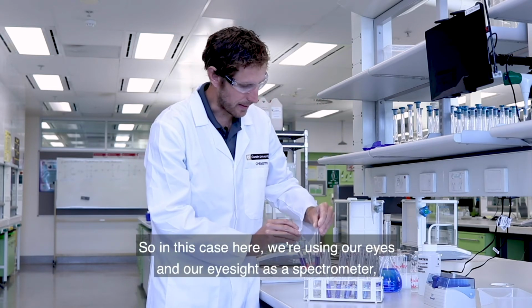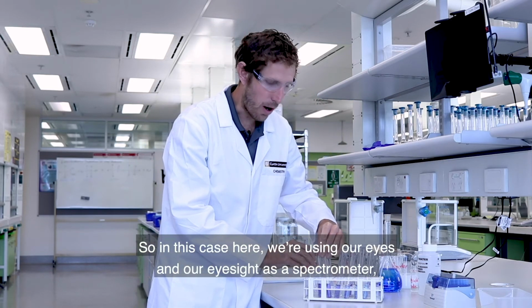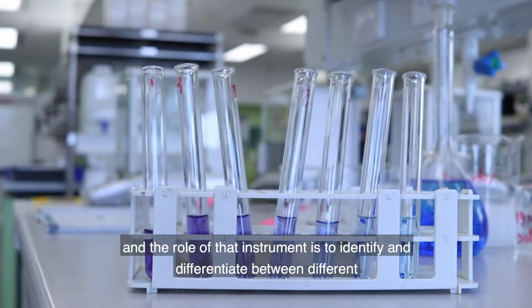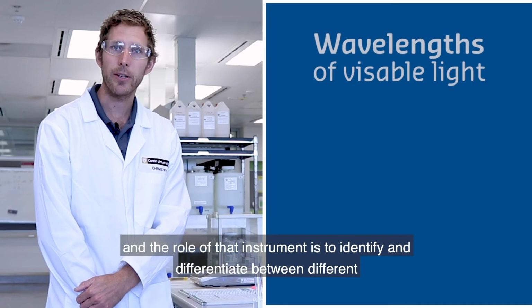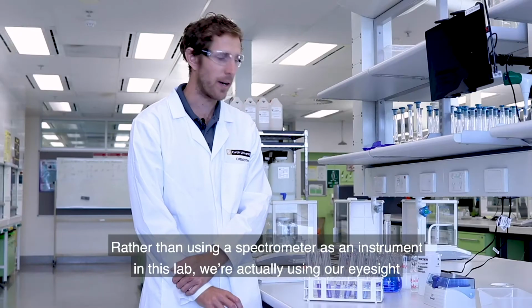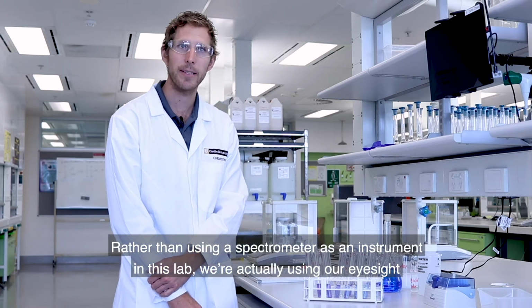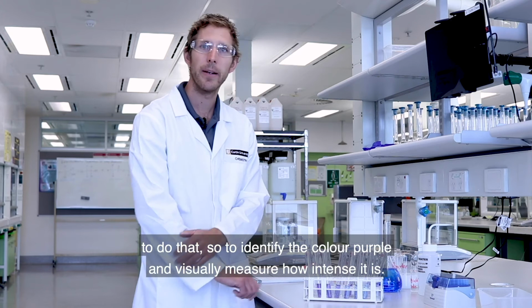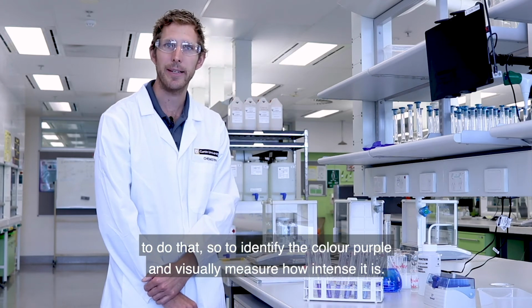So in this case here, we're using our eyes and our eyesight as a spectrometer. And the role of that instrument is to identify and differentiate between different wavelengths of light and to determine how much light there is. Rather than using a spectrometer as an instrument in this lab, we're actually using our eyesight to do that. So to identify the colour purple and visually measure how intense it is.